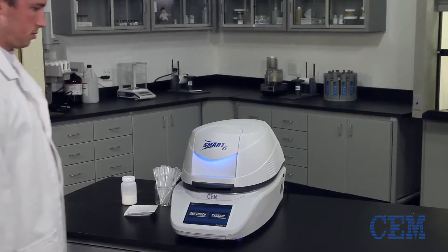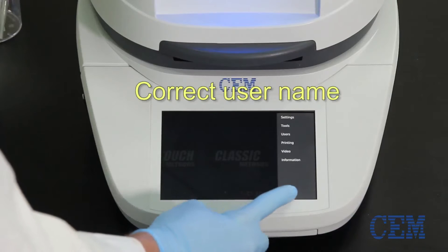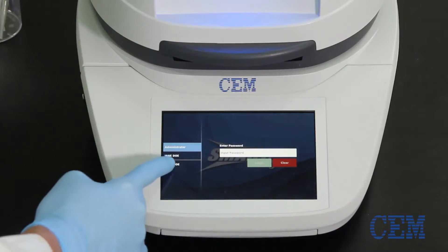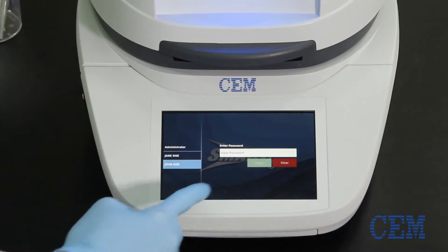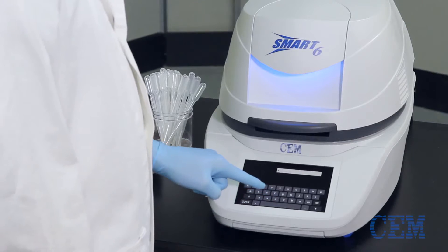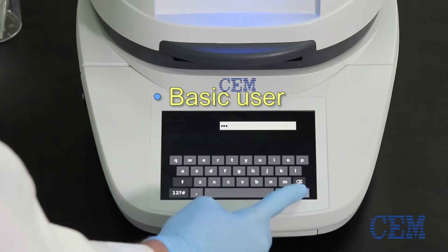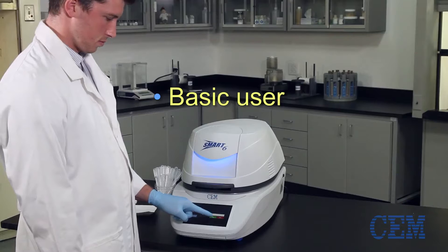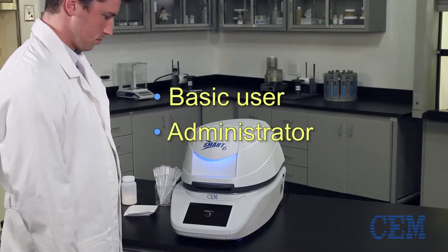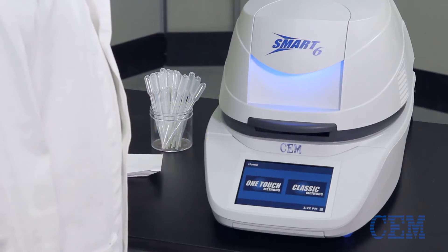Before analyzing a sample, make sure you're logged in under the correct username. Every individual technician can have their own password-protected user login to ensure better data management and improved organization for audit trails. A user can either be designated as a basic user, able to change methods and analyze samples, or as an administrator with advanced capability to make system or method adjustments that improve the functionality of your Smart 6 Analyzer.